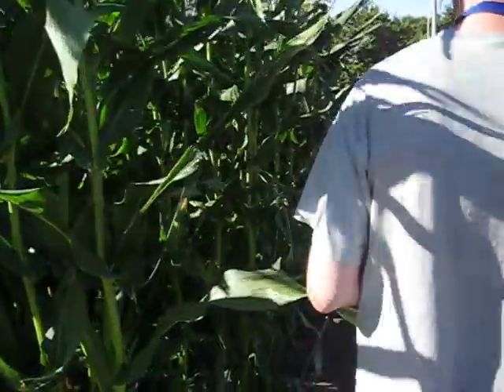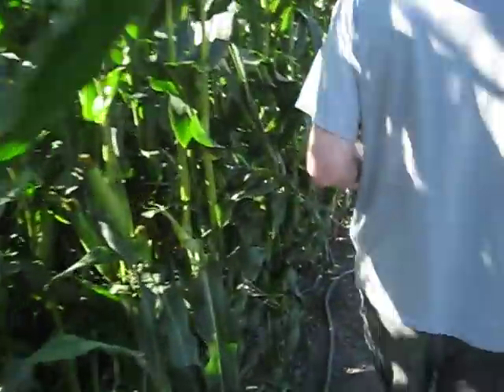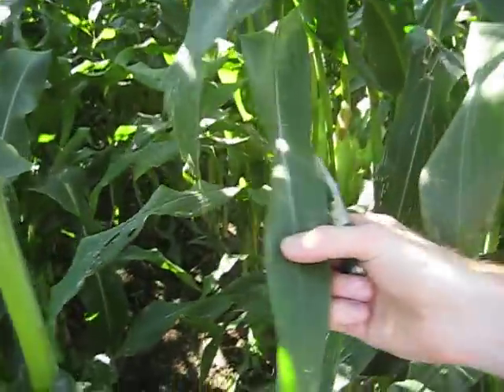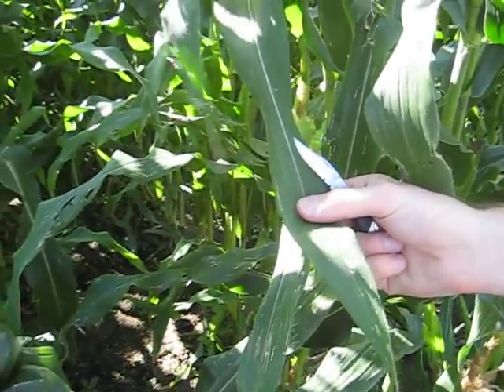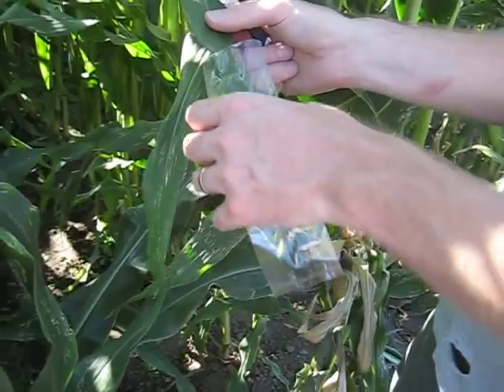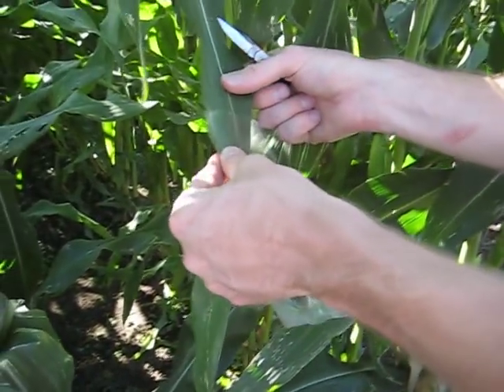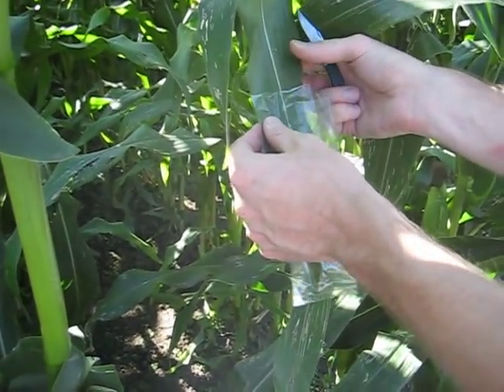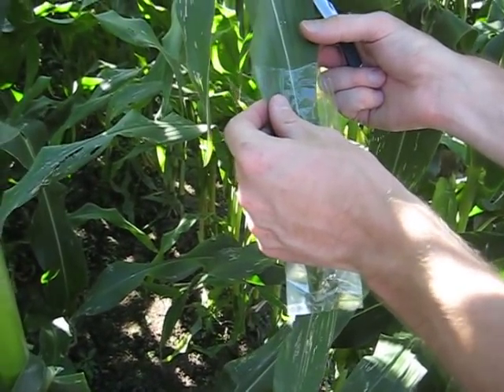We're going to go down here and take a shaded leaf. So we're getting in here and grabbing one that's fully shaded, taking a mid-day reading. We're going to actually bag this leaf — we've got a long slender bag that we're going to lace over it. All that bag does is slow down the transpiration on the leaf.